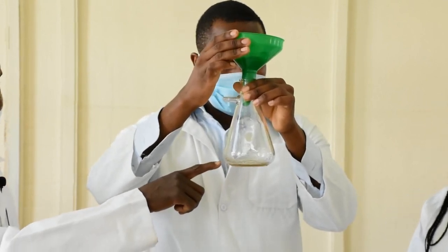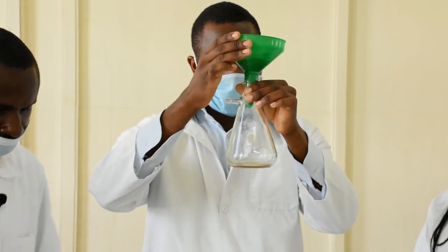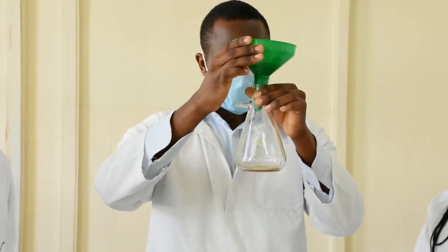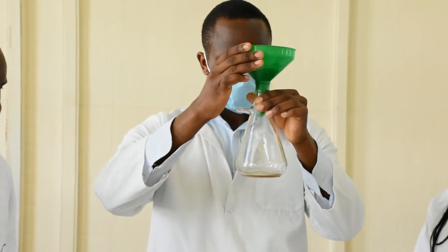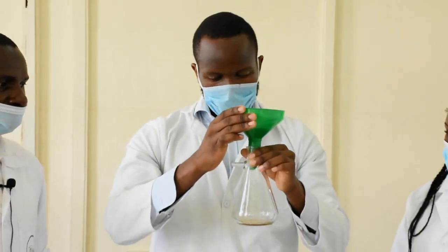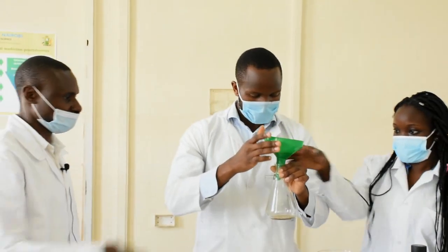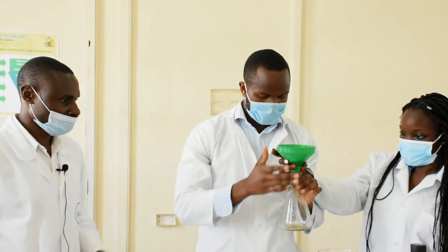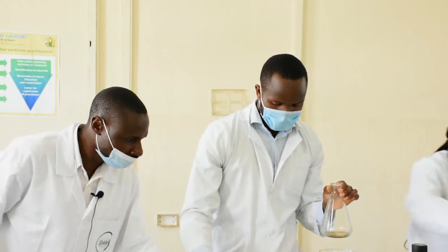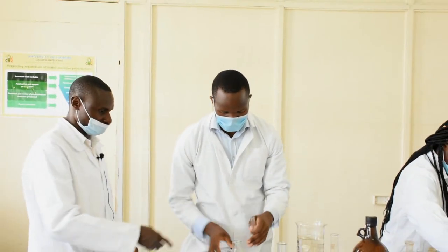You can see the buffiness — it is there, very small but visible. Once the white to buffy precipitate is achieved, you are supposed to make the rest of the solution alkaline.